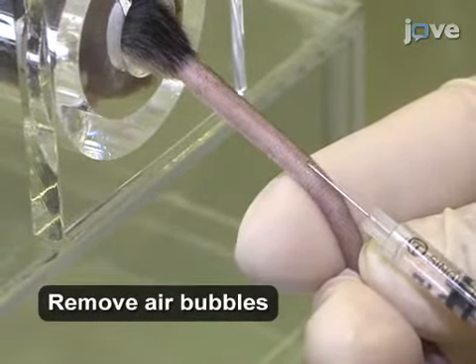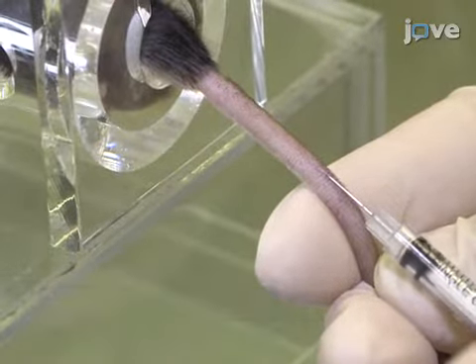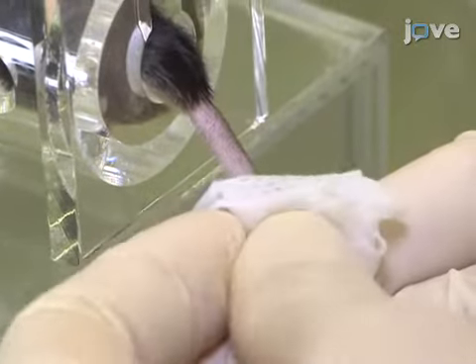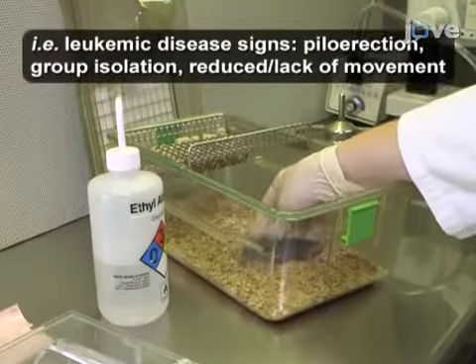Proceed to slowly inject 1 × 10⁶ cells into a lateral tail vein. When all of the cells have been delivered, remove the needle and apply gentle pressure at the site of injection with sterile gauze. Then return the animal to its cage with careful monitoring for the next several weeks.